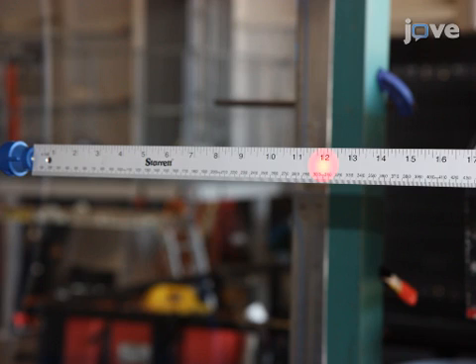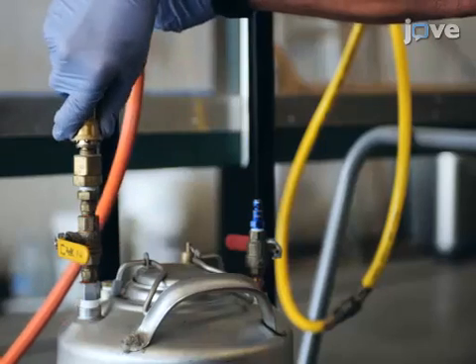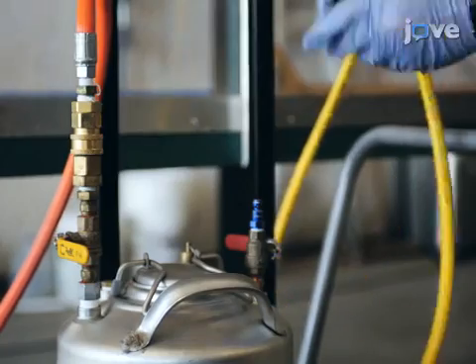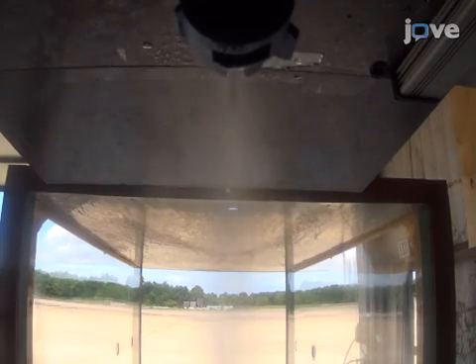Once mastered, this technique can be done in 10 to 15 minutes for a single combination of nozzles and operational conditions. When attempting this procedure, it's important to properly set up and align all equipment and nozzles to make sure that your results are accurate and repeatable. Following this procedure, other imaging techniques can be used to further explore the spray structure. After its development, this technique paved the way for researchers in the field of application technology to develop a number of droplet sizing models. These models can be used by applicators to set up their spray systems to comply with pesticide application regulations.